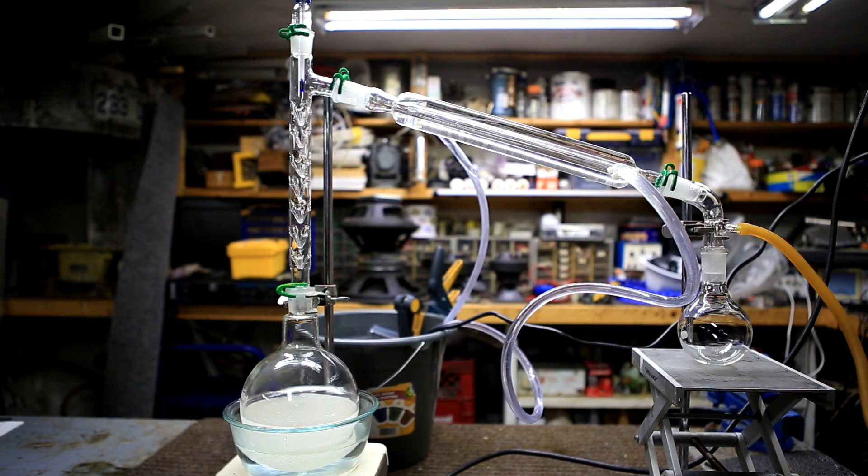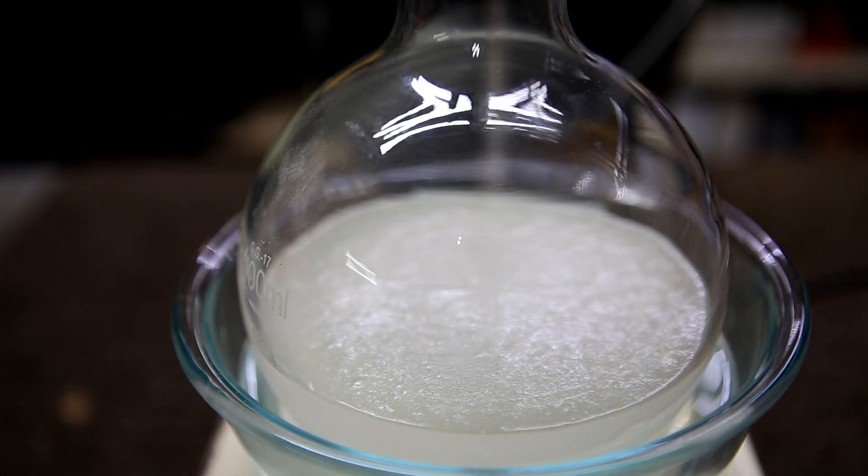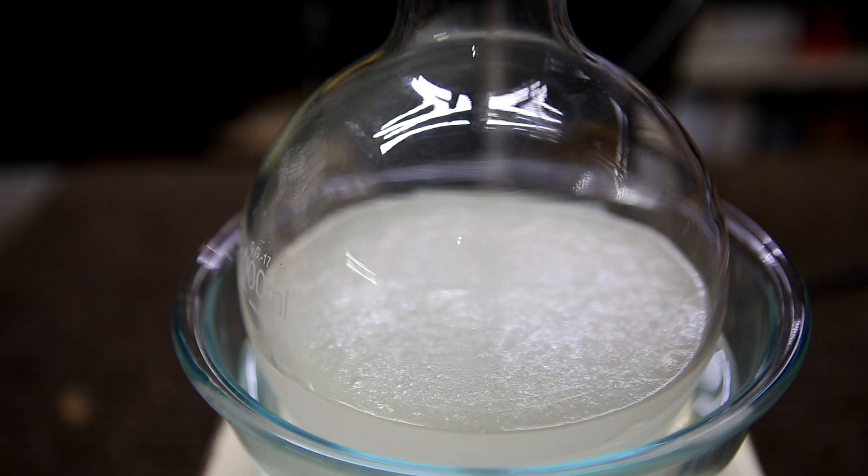I then set up a fractional distillation, but you can probably just as easily get away by using a simple distillation. The varnish remover was then heated using a hot water bath.